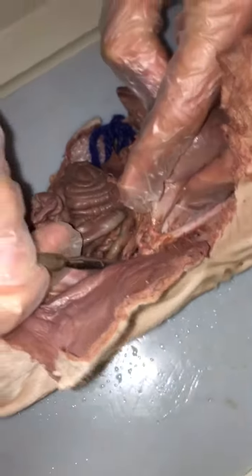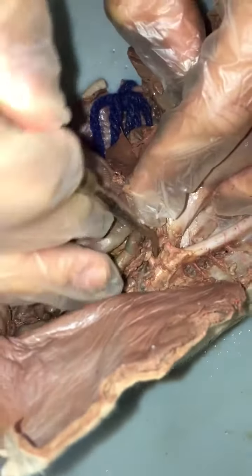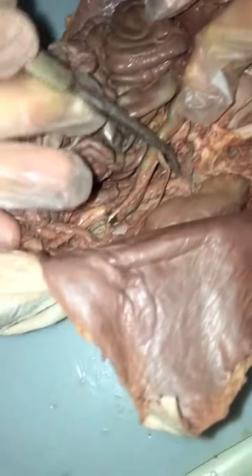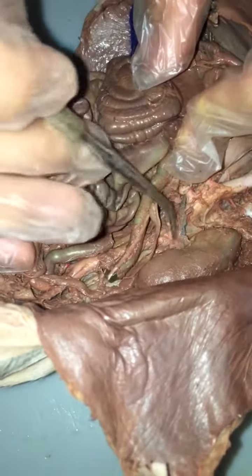Superior mesenteric artery. Then that's the second one coming off. Superior mesenteric artery, right here. Superior mesenteric. Okay, renal arteries. Anything that's renal has to do with kidneys. Celiac, it's under superior. This connective tissue, but that's where the renal arteries are, right?